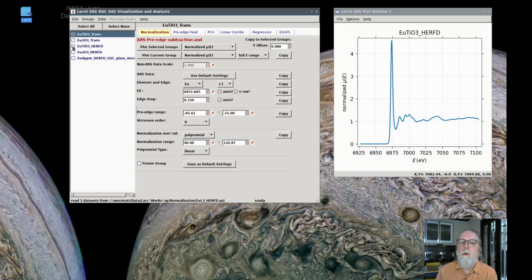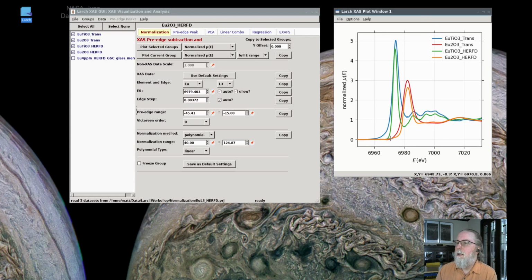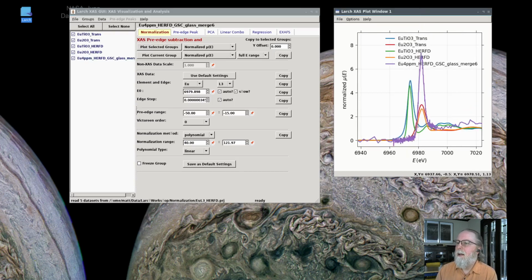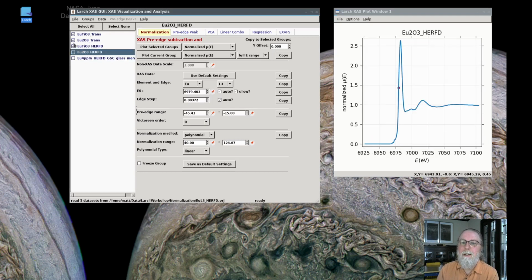And one of the questions for HERFD data always is, so there's the 2+, and here are the 3+ spectra together, measured in transmission and in HERFD. And then this other data set, I'm going to show this here in purple. Clearly, you can see that the data on the unknown, the low concentration sample, is 3+. That makes it really easy to work with. But one question that often comes up when dealing with HERFD is whether you could just smooth the HERFD data to reproduce the transmission data, the total fluorescence yield data, or if you can take data measured in standard mode and just do a deconvolution of it to reproduce the HERFD data.